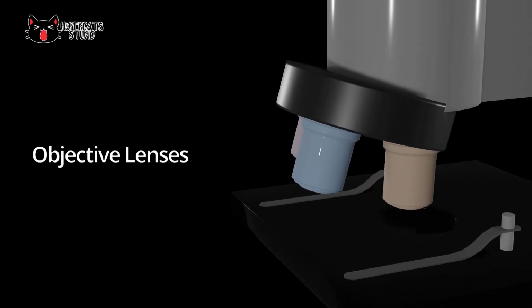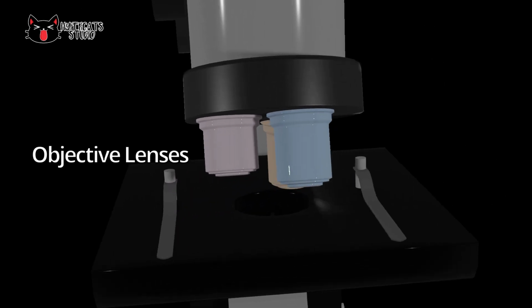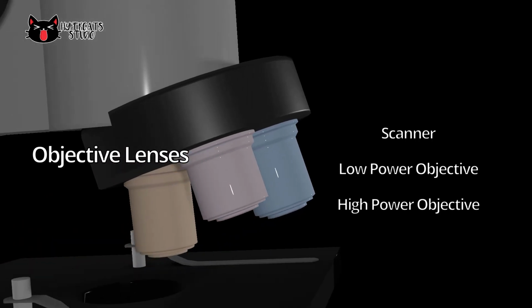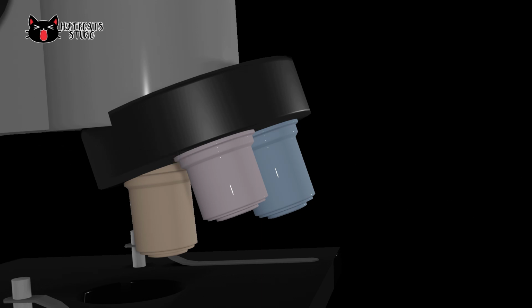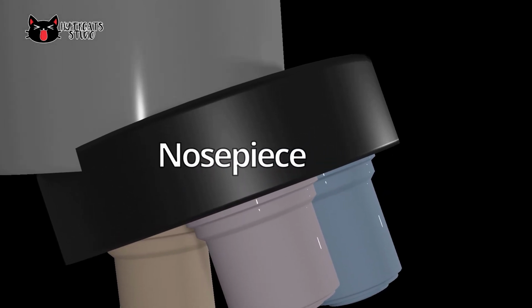Objective lenses are the major lenses used to magnify a specimen. They have a magnification power of 40 to 100 times. There can be 1 up to 4 objective lenses placed on a microscope. Each lens has its own magnification power. The revolving turret or nosepiece holds the objective lenses.